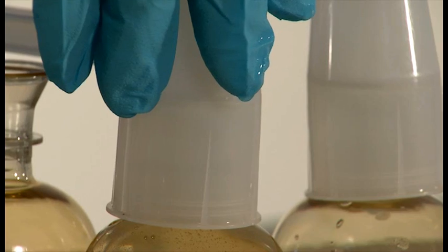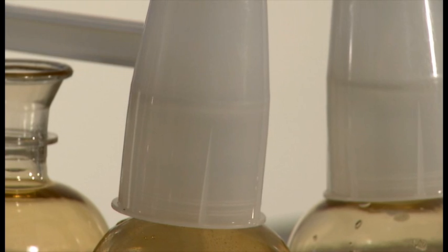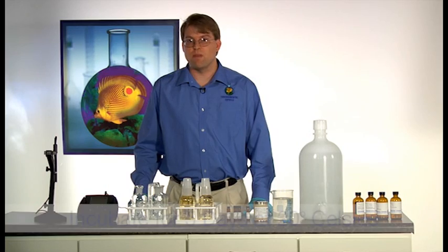Place the overcap onto the bottle and it is now ready for incubation. Samples should be incubated for five days at 20 degrees Celsius.